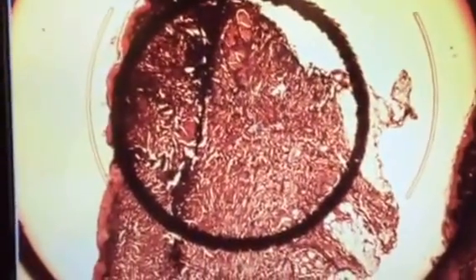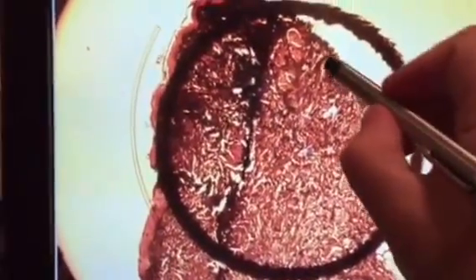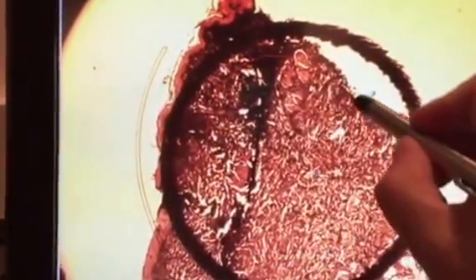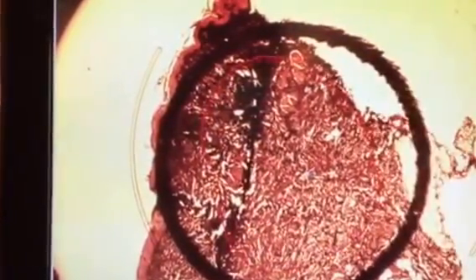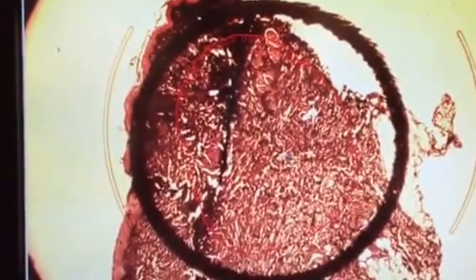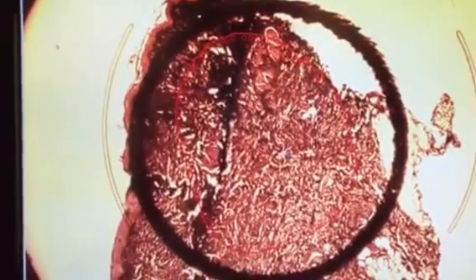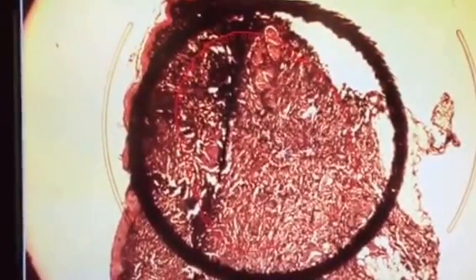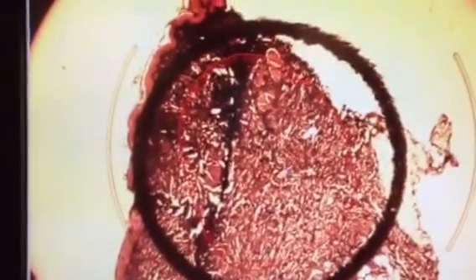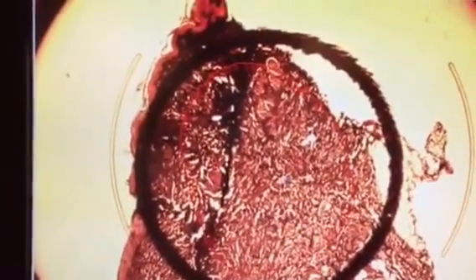Once the cap is on the slide, you can draw the area that you want to extract. Since this whole piece of tissue is good, we're going to extract this area here. Extracted tissue is decided on 2X, and then on 10X is where we actually do the extraction.